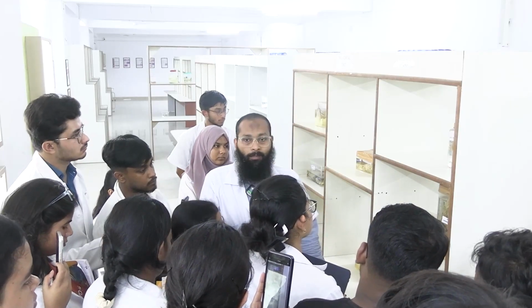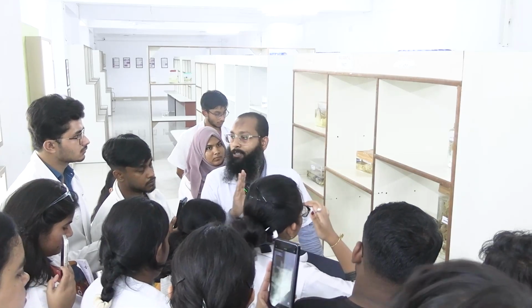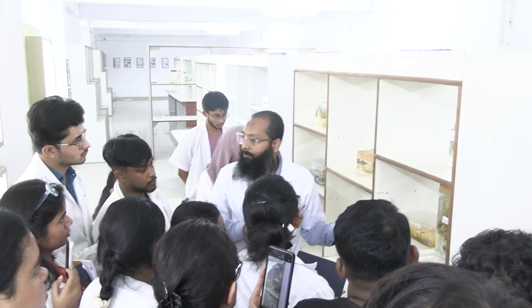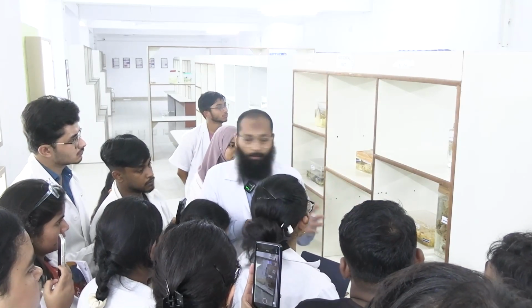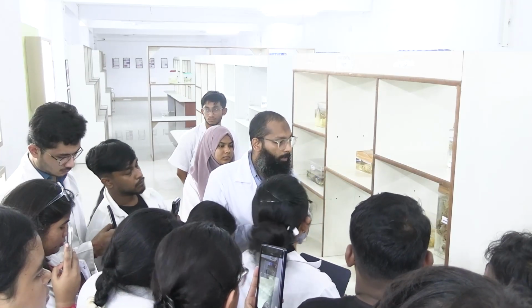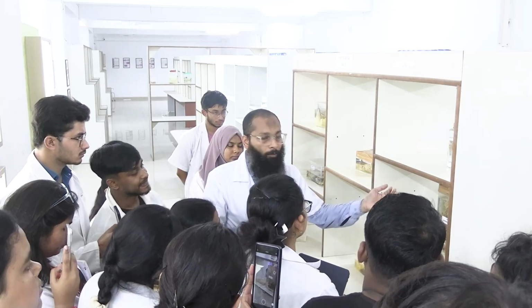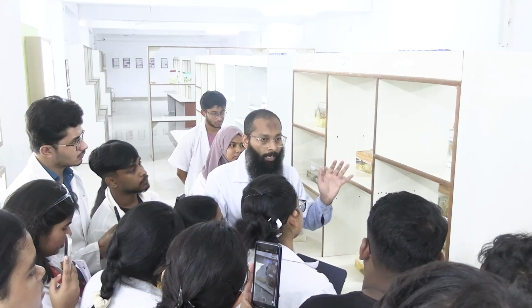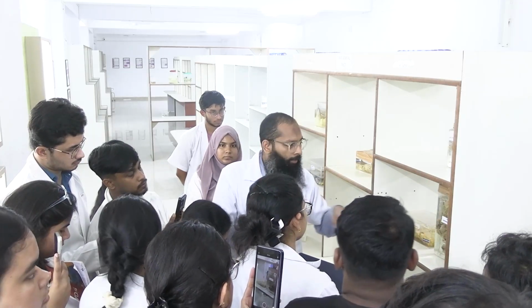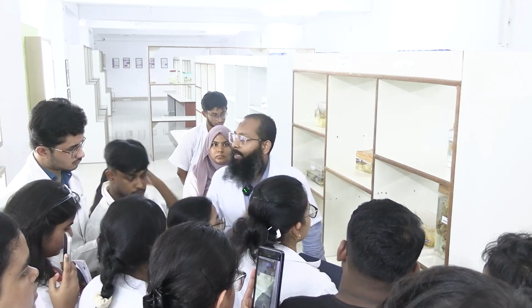So these are the various causes of a mass, but the most important point is that in case of carcinoma breast, the mass will be ill defined. In all those, not 4, 3 cases which I told you, fibroadenoma, Phyllodes and DCIS, it will be well circumscribed, okay. In Phyllodes, the mass will generally be too large in size, but in the rest of the cases it could be large, it could be a smaller one also, okay, fine, clear হয়েছে?